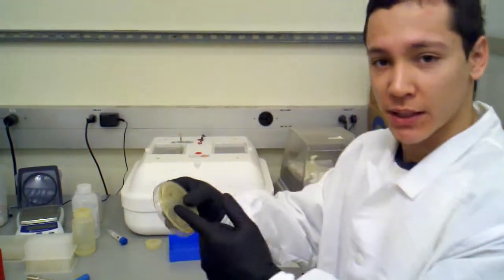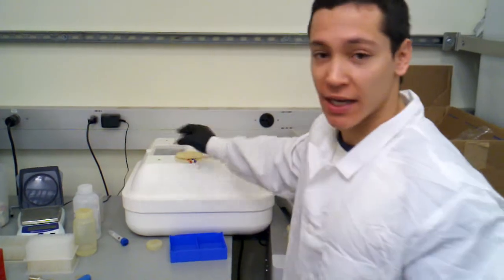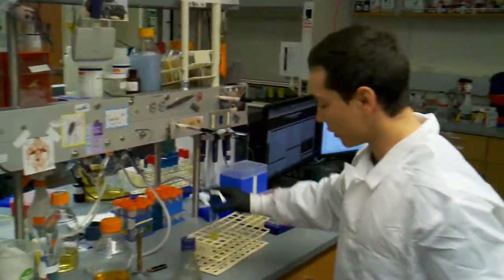So I pulled it out of here, picked a colony, let that shake at 30 degrees overnight, and that's how we ended up with this little test tube of overnight culture right now.